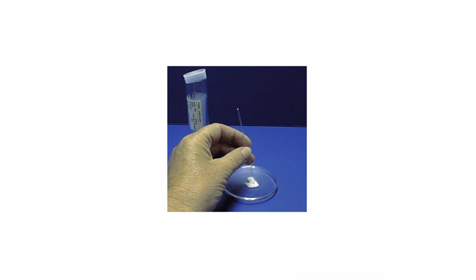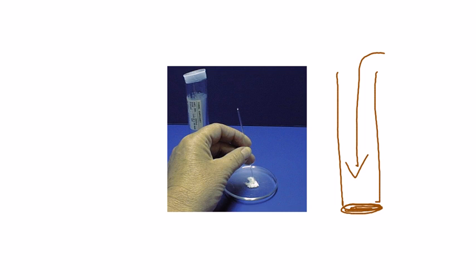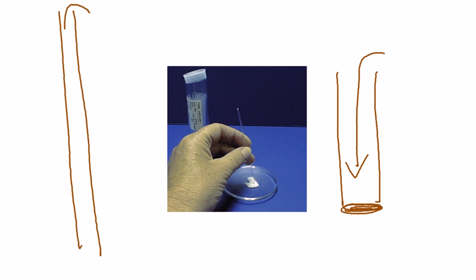Then you invert the capillary tube, and you will see that your solid essentially falls to the bottom of the capillary. Tap a couple of times on your bench top. We are going to provide you long glass tubes, so it's a good idea to let the capillary fall through that onto the bench top, maybe 3 to 4 times.